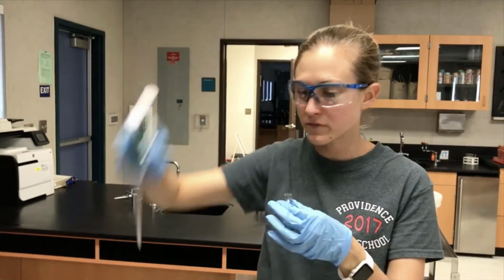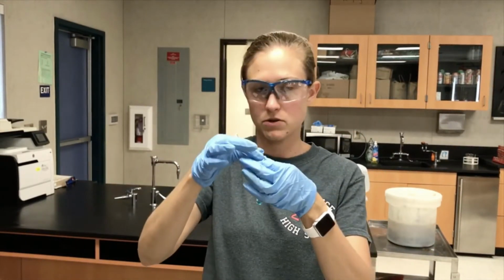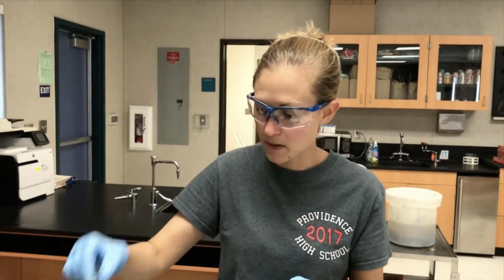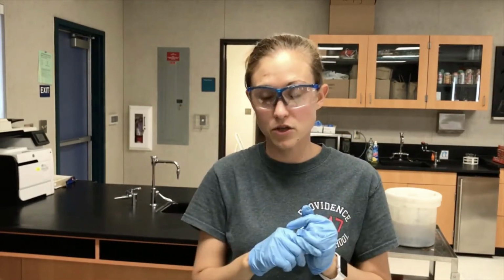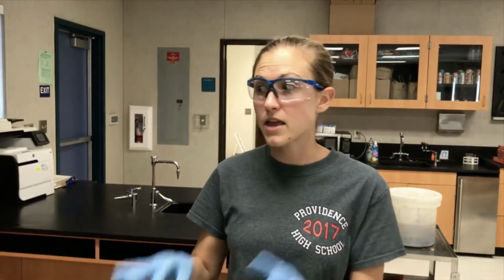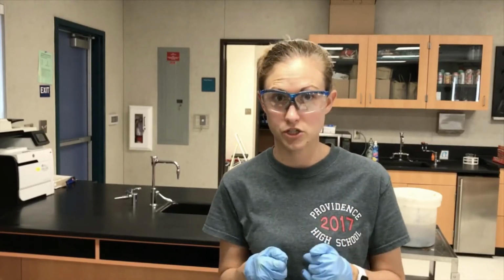So I've got one of the 4 solutions that I need to dilute, and you're going to do the other 3 calculations. Okay? So what you'll have in front of you is a total of 5 solutions, one with a 0.4 molar and then the other 4 that you created. Once you've created that, then we can go over to the spectrophotometer and use that to actually measure the absorbance and compare that with concentration.